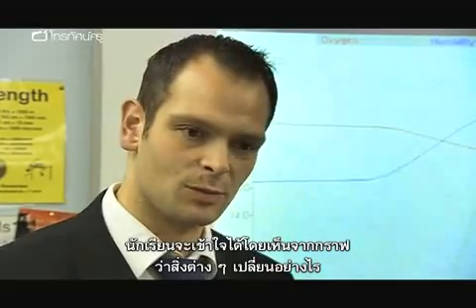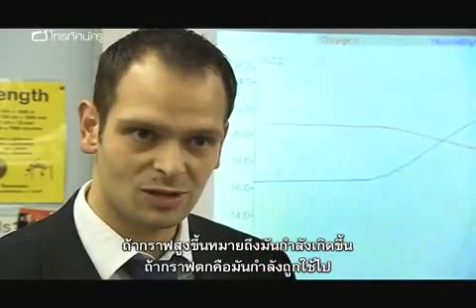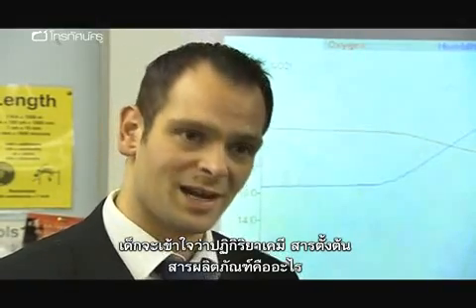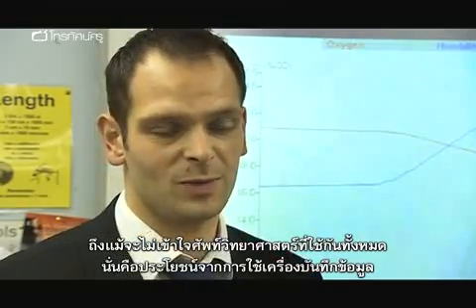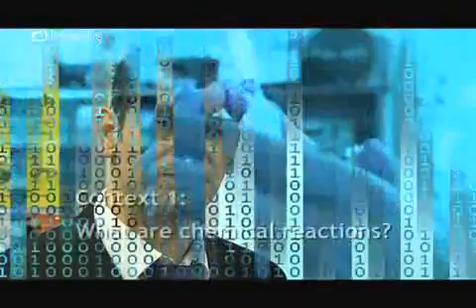And then they start to appreciate looking at a graph to see how things change: if it's going up, it must be being produced. If it's going down, it must be being used up. So they start to appreciate what a chemical reaction is, what reactants are, what products are, even if they don't fully understand all the language we would normally use when we're talking about science. So that's the benefit of using the data loggers.